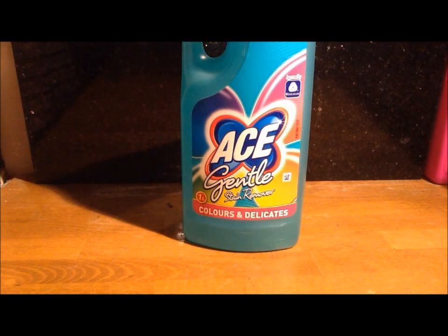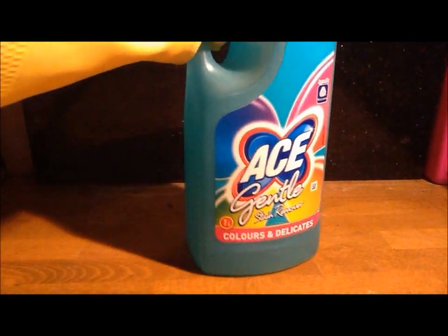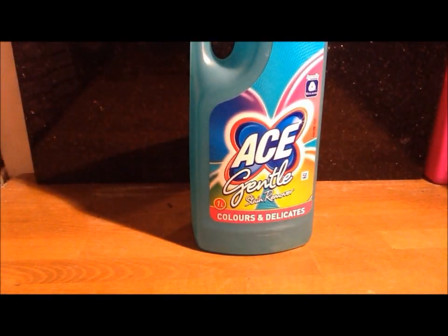Hello, and today we're going to be testing this ACE gentle bleaching agent for some common household chemicals.